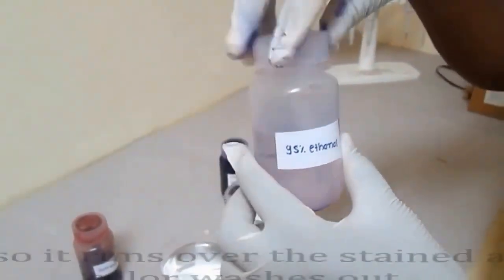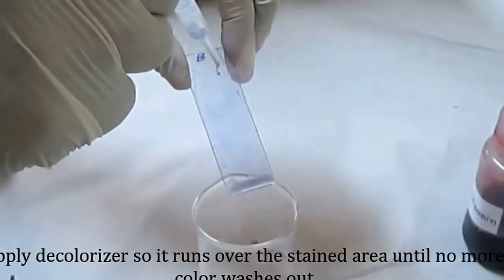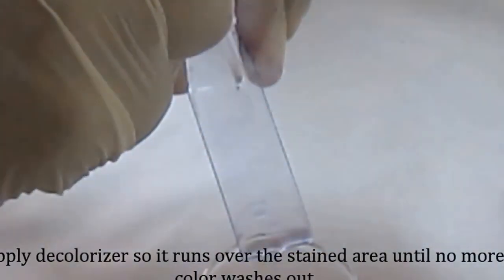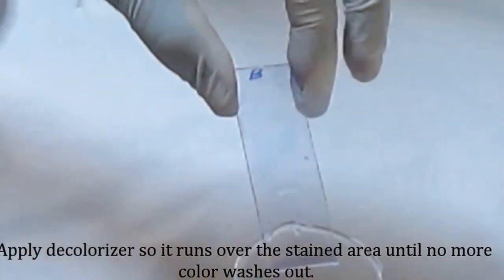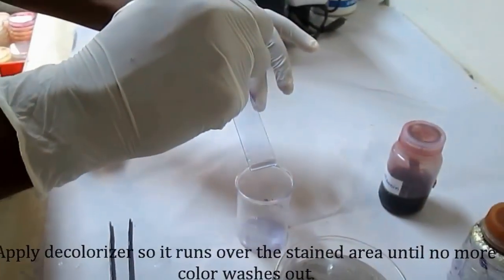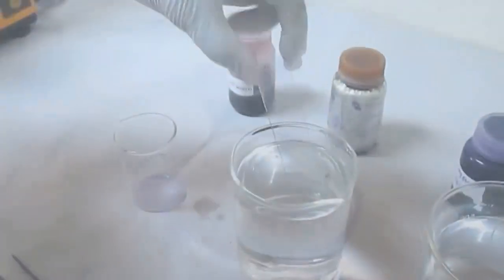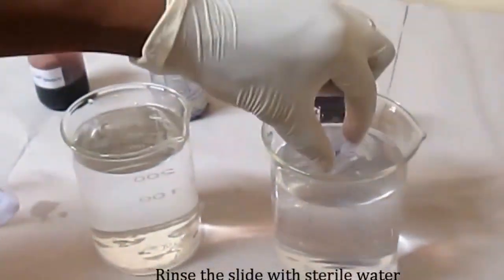95% ethanol. It acts as a decolorizer. Apply the 95% ethanol and run it over the stained area at a 45-degree angle until the flow is clear. Check the flow at the base or end of the slide. After running the slide with ethyl alcohol, rinse the slide in the sterile water in order to remove the remaining dye.